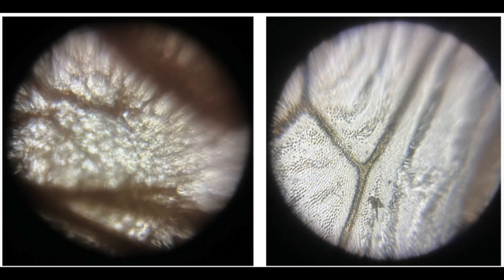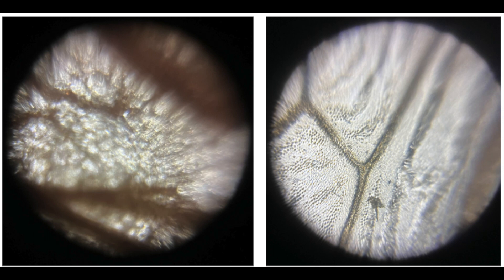Veins. On a microscopic level, the veins of the maple seed leaf are almost opaque under the Foldscope. They are brown in color and show extensive branching throughout the leaf. The veins of the insect wing are yellowish-brown and darker than the surrounding membrane, but still translucent. The insect wing veins do not show a great deal of branching throughout the membrane. The veins in the maple seed leaf and the veins in the insect wing are both part of the organism's circulatory system.